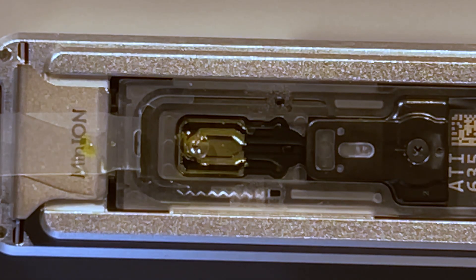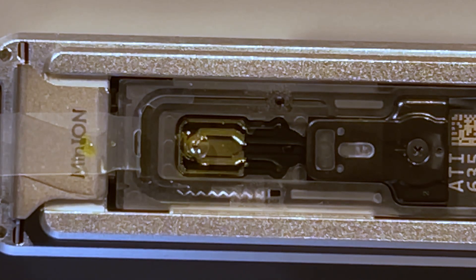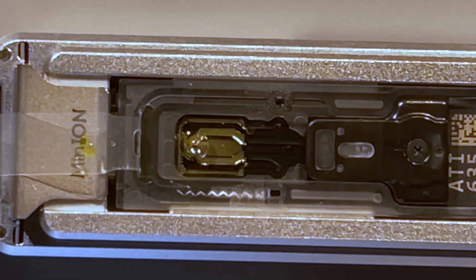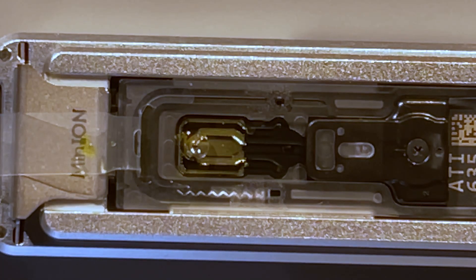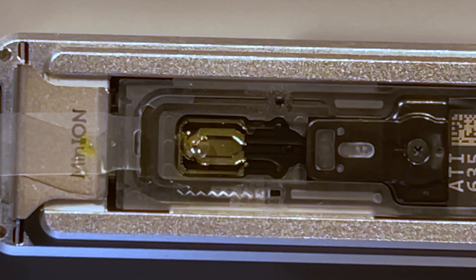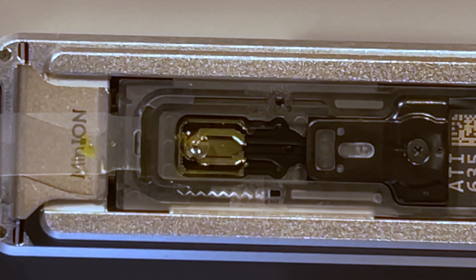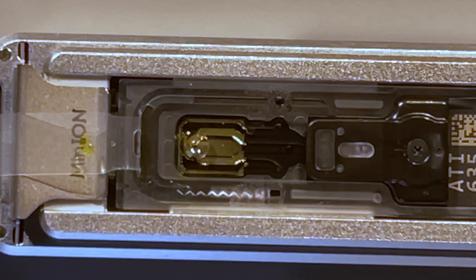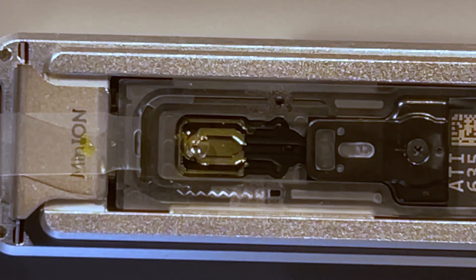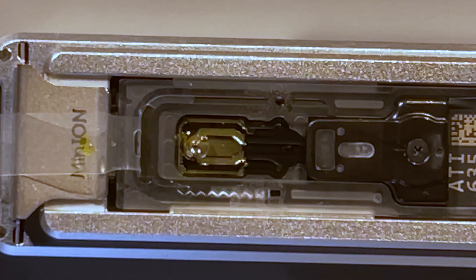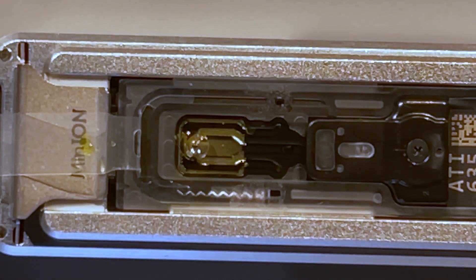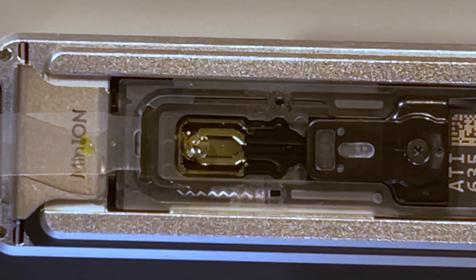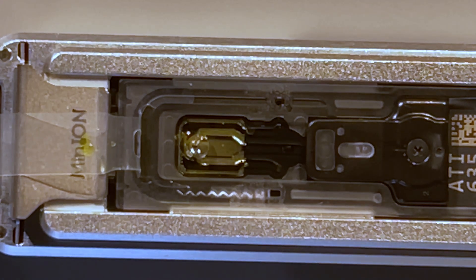And finally, 5 microliters of the library. I'll put that back on ice because it can be used if I needed to load again or something was wrong with my flow cell. Well, in this case, they give you enough for one, but you could make more if you needed—something went wrong with the flow cell, which I've had to do.